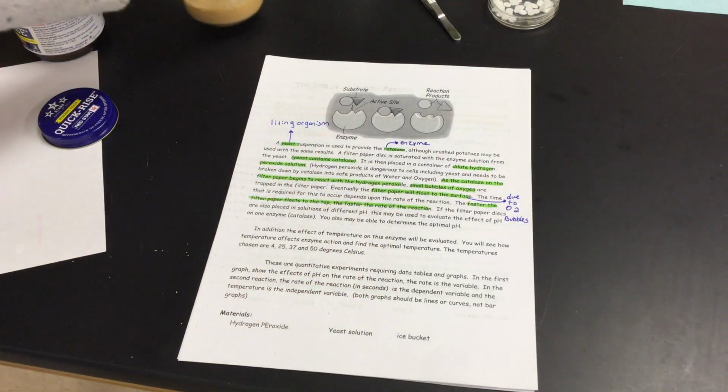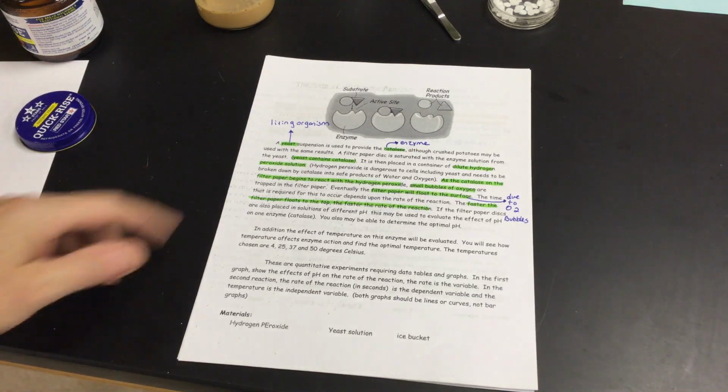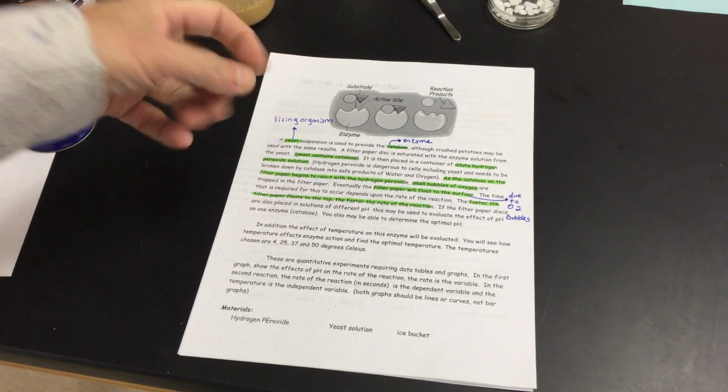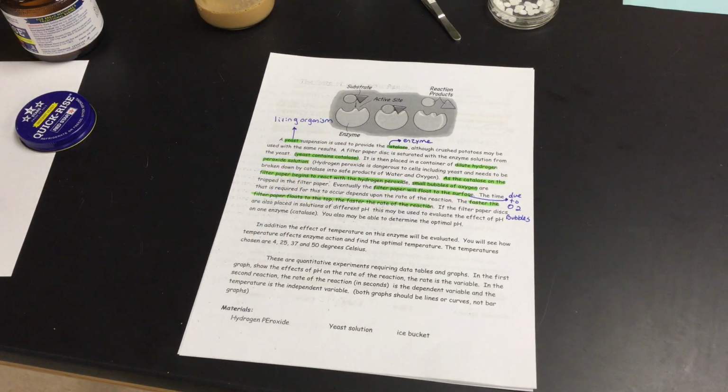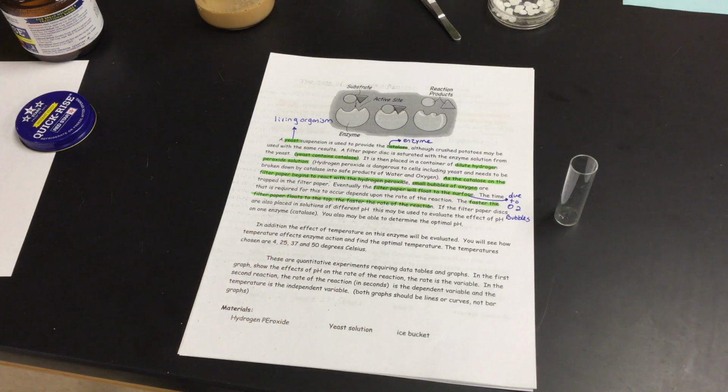So this is what we use in order for us to make things like alcohol or bread. We allow it to ferment, but it is a living organism. So as it's sitting there, we have an enzyme, catalase, in it. That enzyme catalase can be found in our living organism of yeast, and that's what we're going to end up utilizing today. So we're going to fill these little tubes with different hydrogen peroxide solutions, and we're going to fill them to the top.